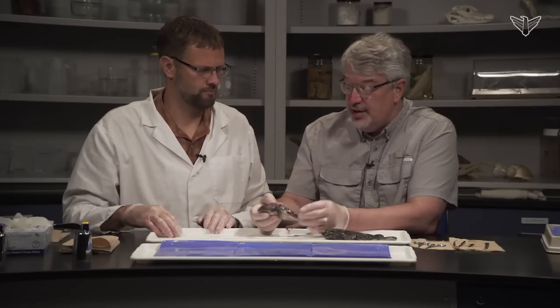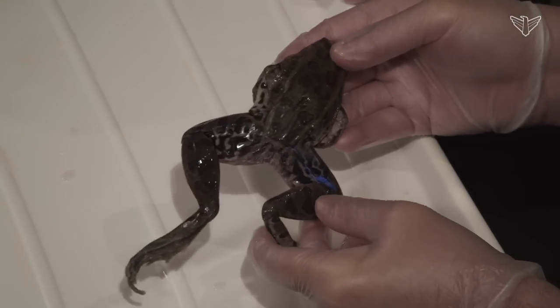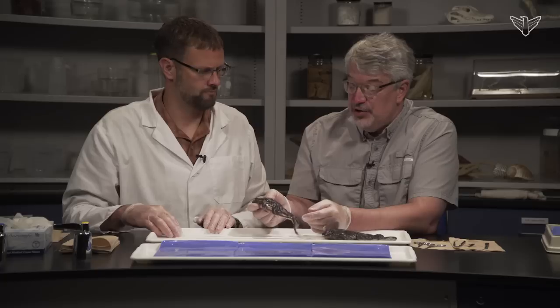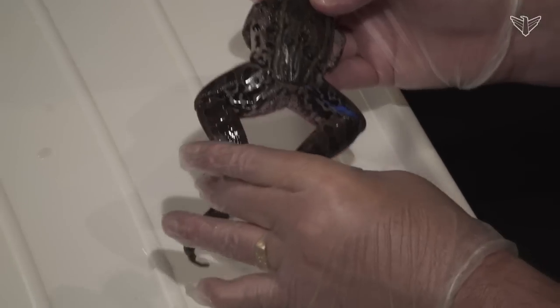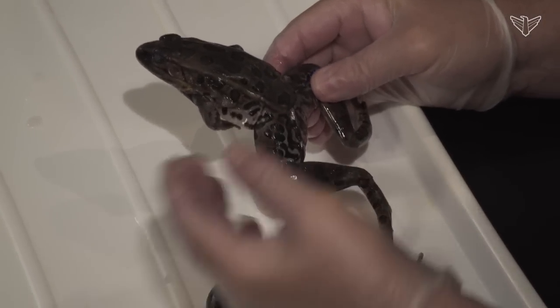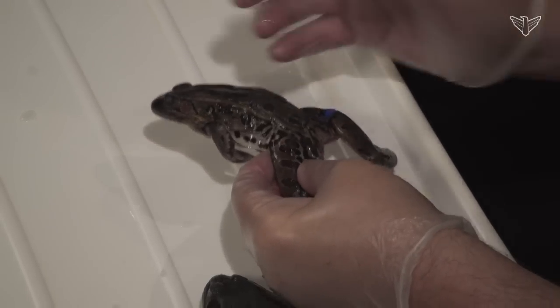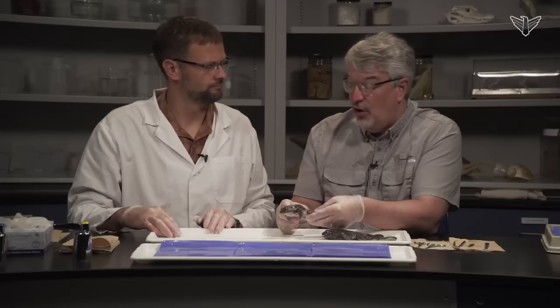Frogs are atypical in amphibians in that they lack a tail. They're in a group called anurans, which the name itself means without a tail. As everybody knows about frogs, they're highly modified for jumping, so they have these extended back legs which allow them to leap long distances, or at least to hop like toads do. They are the largest group of amphibians — more frogs and toads than any other kind of amphibian — and fairly easy to obtain.